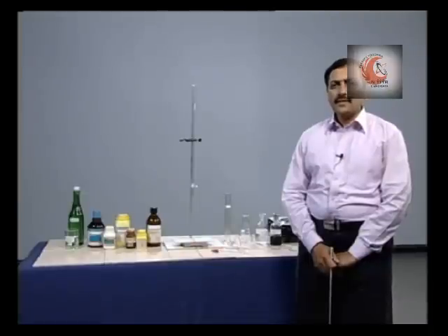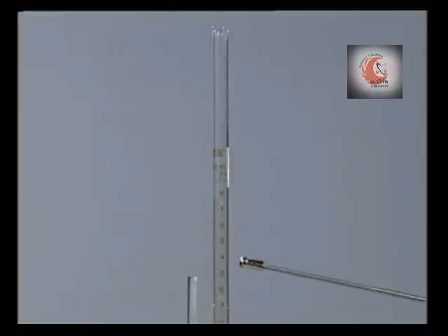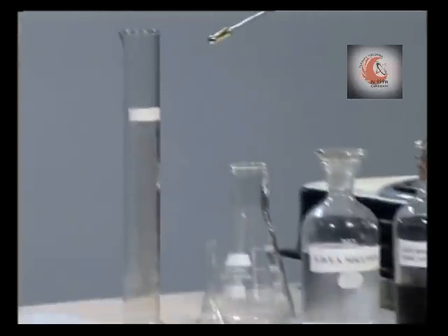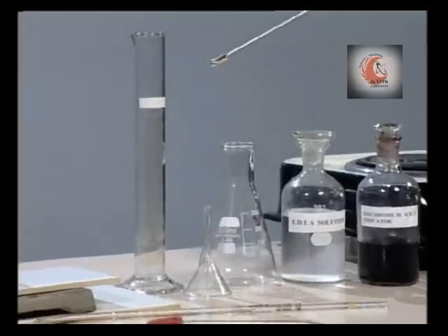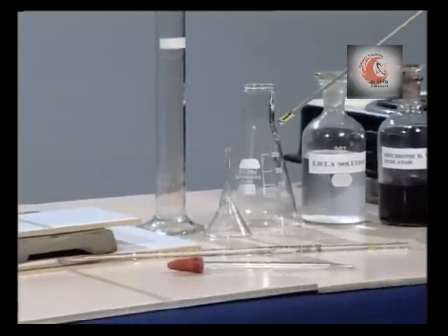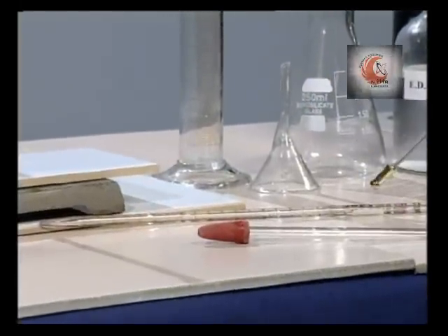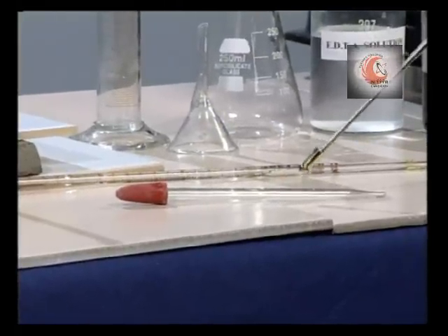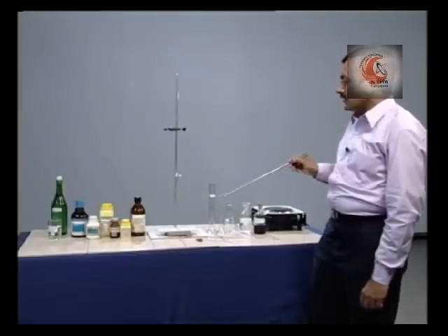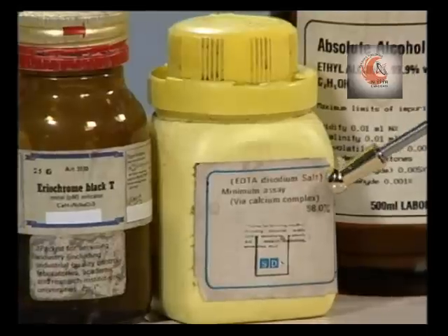We need simple glassware like a burette of 25 or 50 ml capacity with a burette stand, a measuring cylinder of 100 ml capacity, a conical flask of 250 ml capacity, a glass funnel, and a pipette of 1 ml capacity.